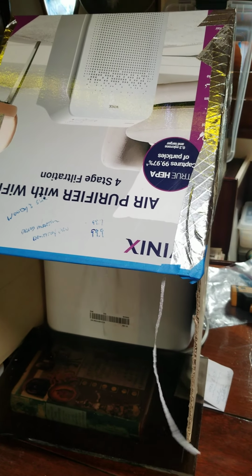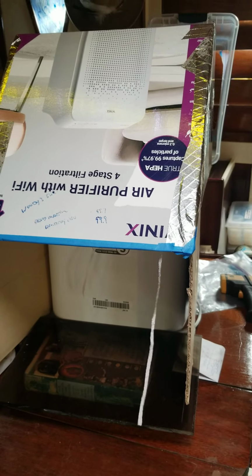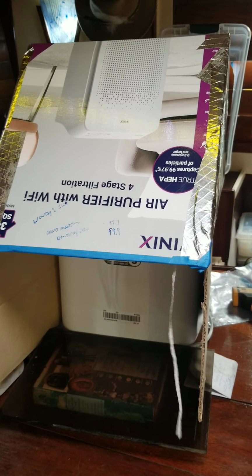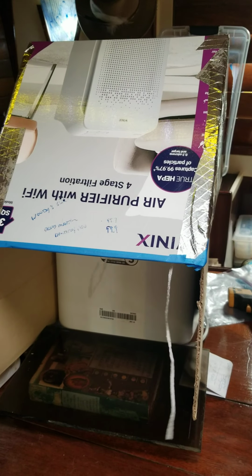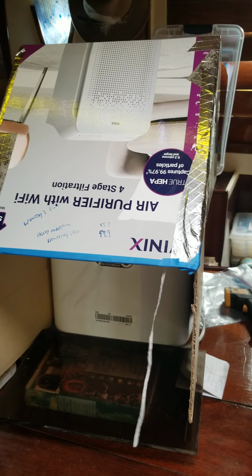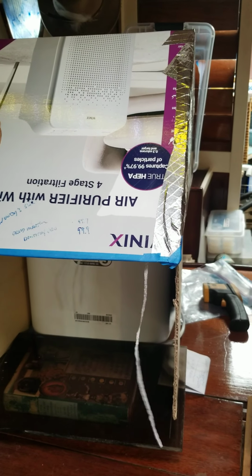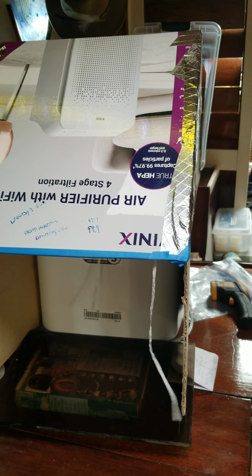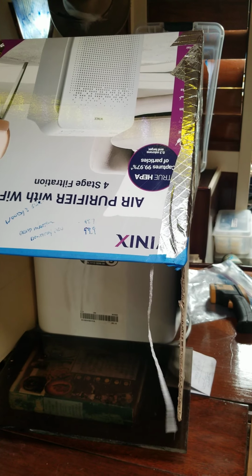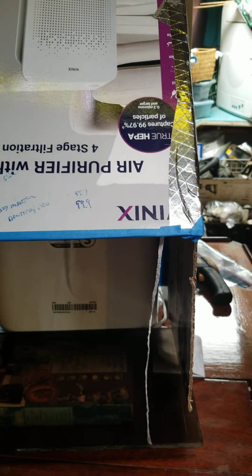I've opened containers and done transfers, and so far I have no contamination of any kind from just air inoculation. And in fact, I just set an agar plate over on the wood stove just to see if I would get contamination from that, and even that gets nothing, where before all I got was contamination.